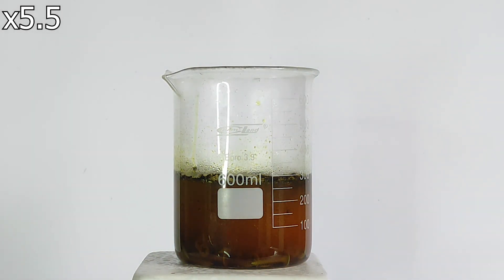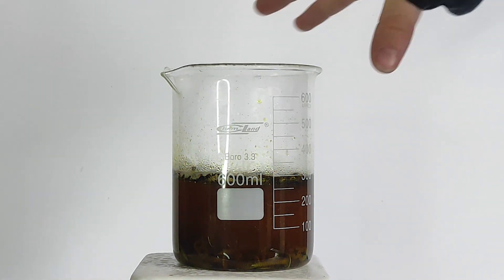Decently pure because there may be some metals like zinc or aluminum dissolved in the solution, because nails aren't a very high-grade source of iron. So I've let the acid do its thing for 24 hours and I went to play some Fortnite.